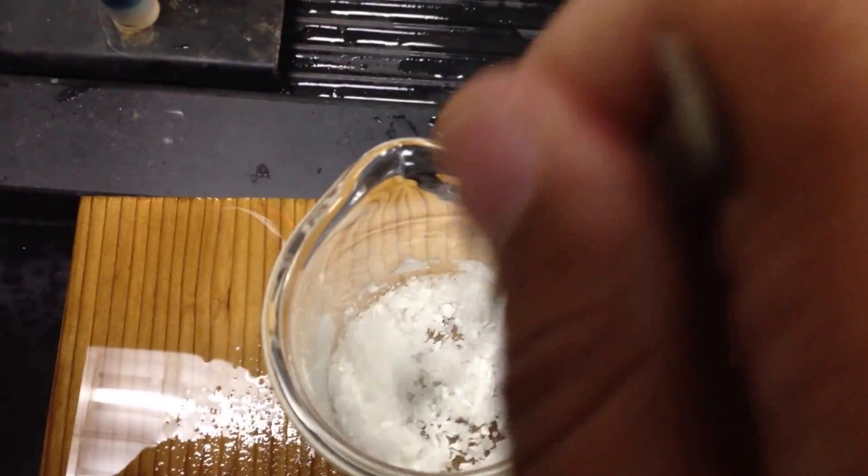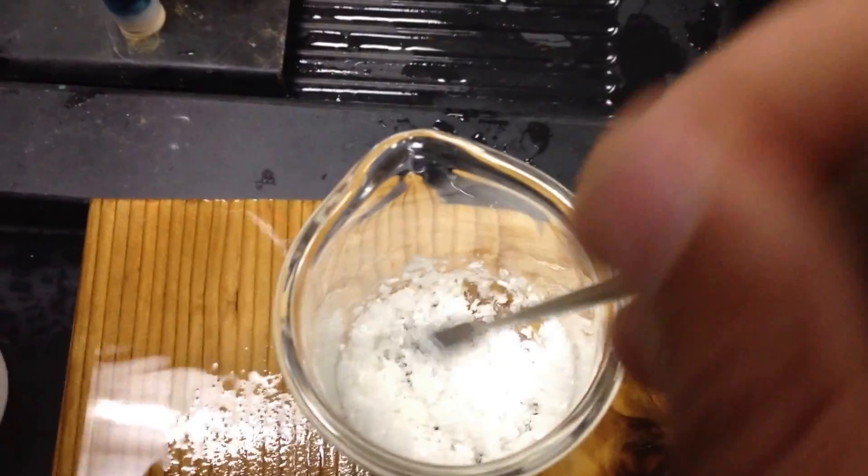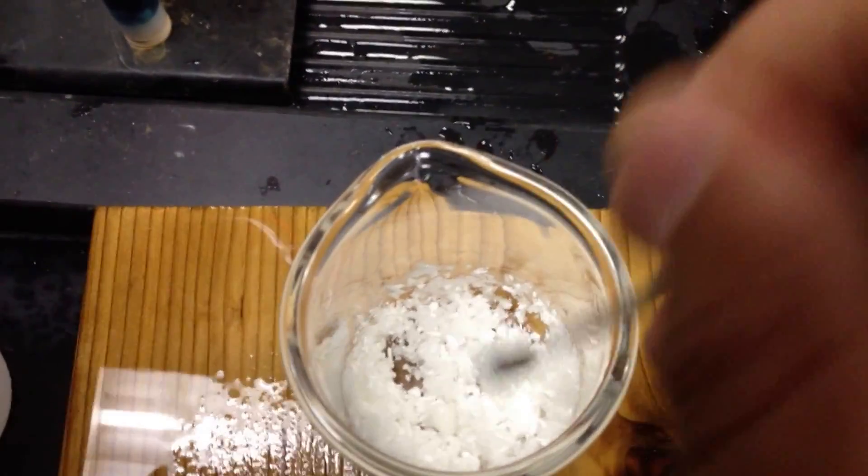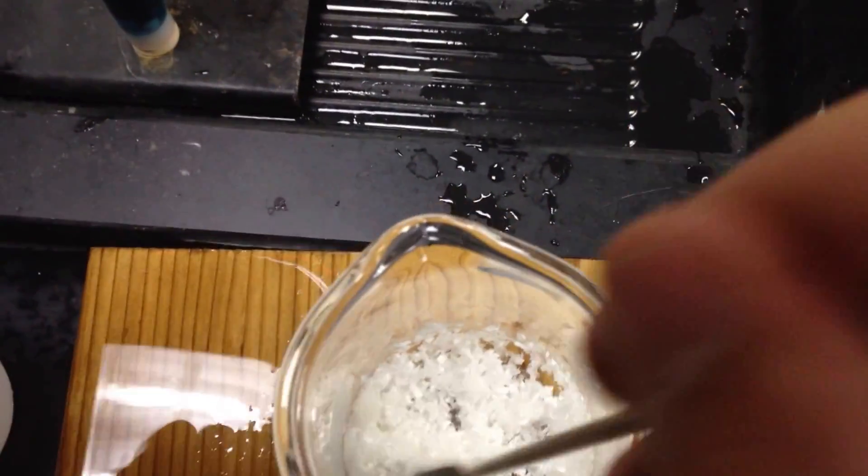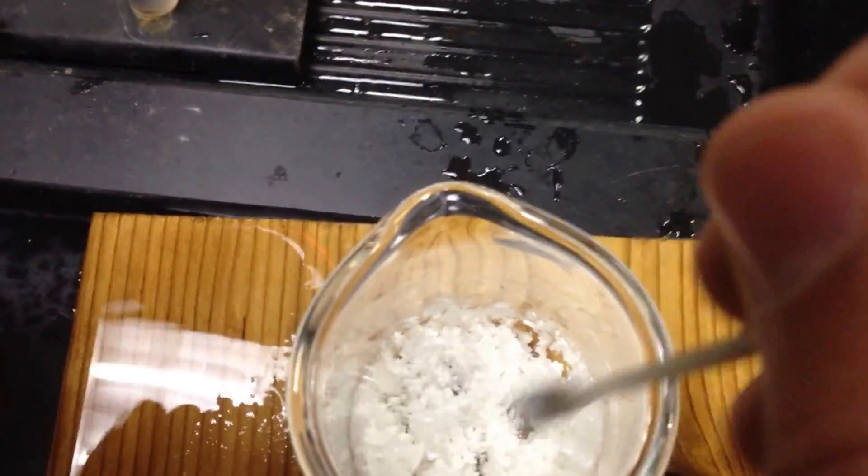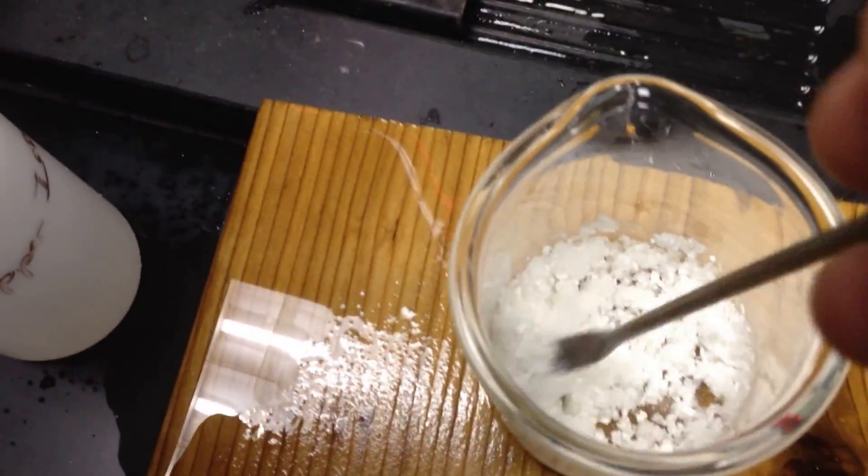So what's happening? Is it still the same? I'm guessing the stoichiometric ratio now because I poured in the wrong ones. Just stay with me for a second. It's craziness, right?